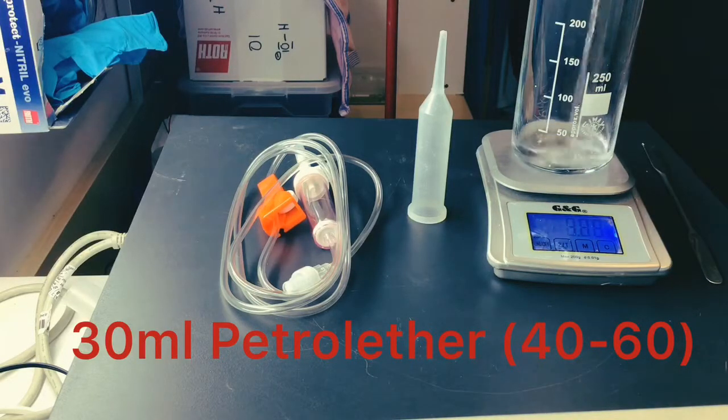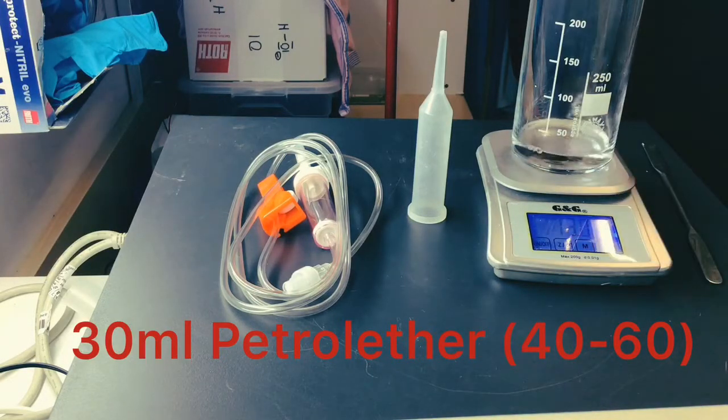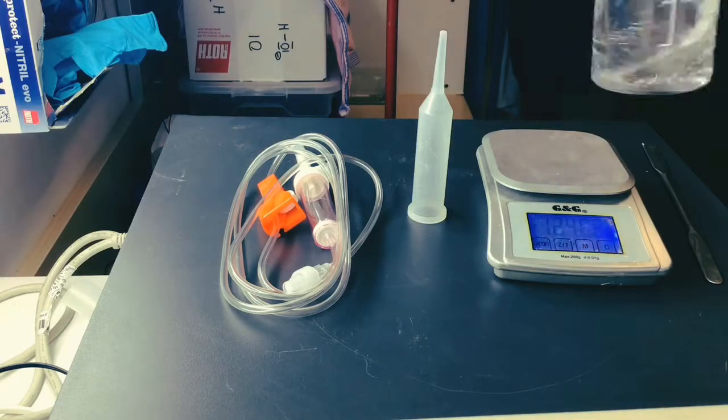Now add 30 milliliters of petrol ether. Stir it properly until the oil is dissolved.